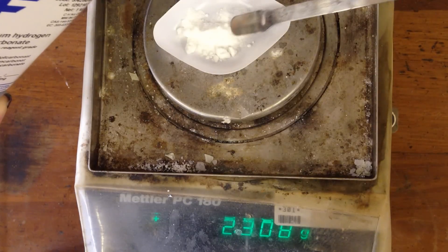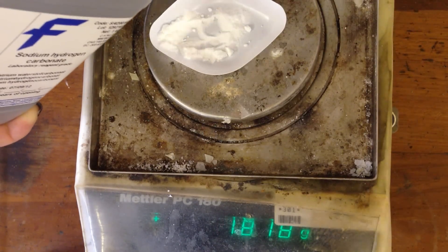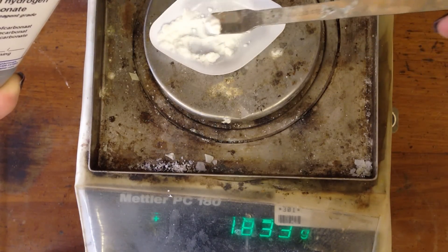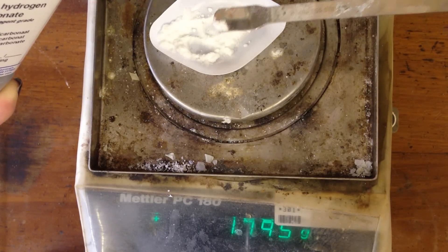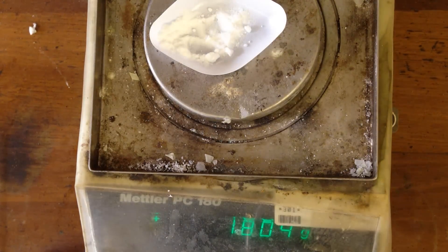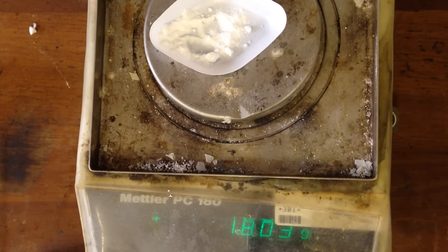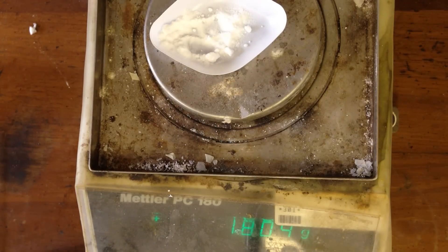So that is way too much, take some off. Okay, 1.78 grams, that's close. Let's see if I can get a bit closer. So 1.795 grams, add a bit more on. Okay, I'm happy with that. It's not exactly 1.8 grams but it is very, very close. Now I need to record this number so that I can use it later. 1.804 grams.